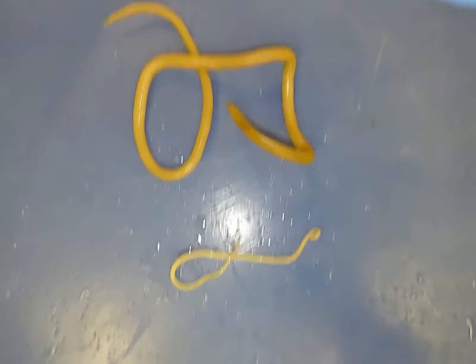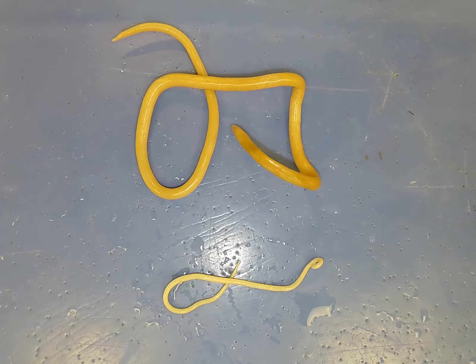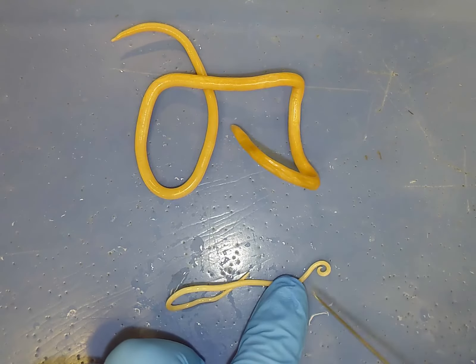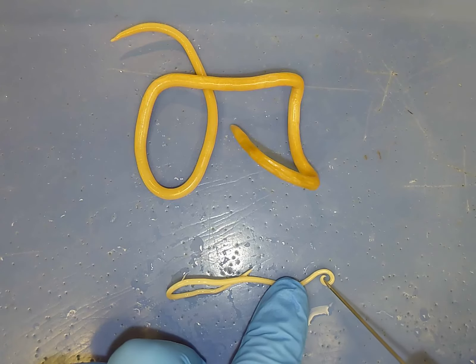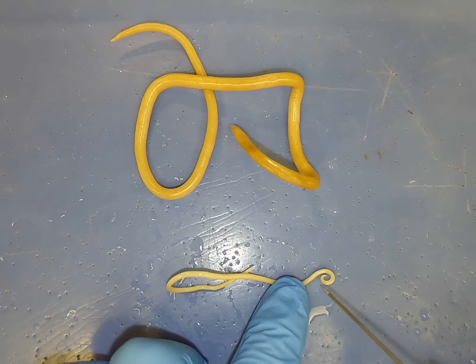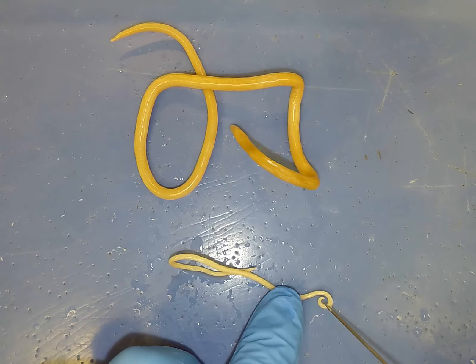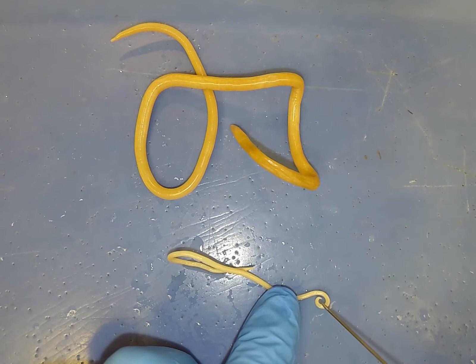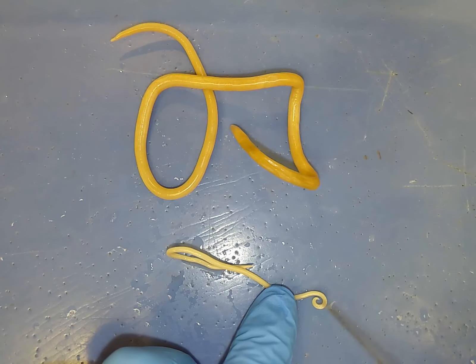Here I have both a male and female. Let me zoom out a little bit. As you can see, they look nothing alike — this is what we consider sexual dimorphism. Males will be much smaller and they'll have this hook or spiral at the end. Inside of this spiral will be a couple of structures called copulatory spicules, which are really difficult to see without a dissecting scope.